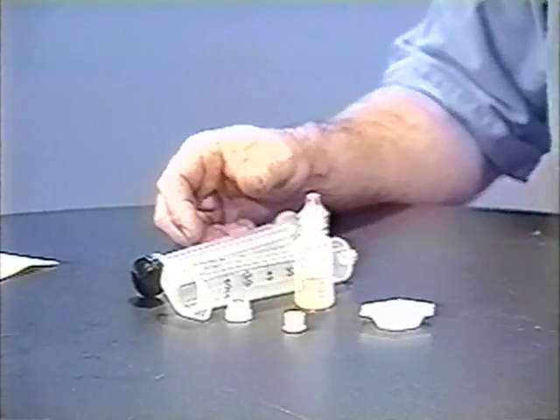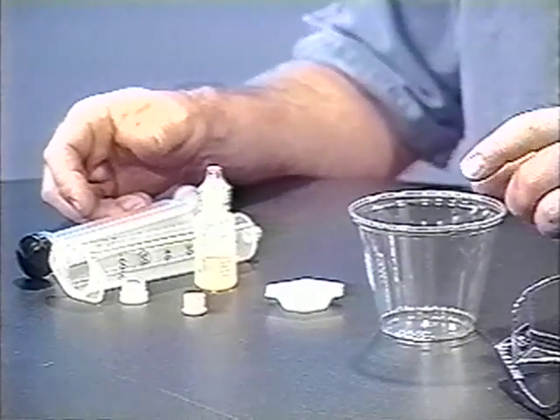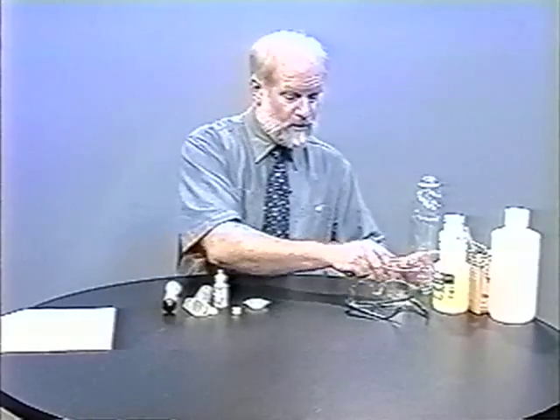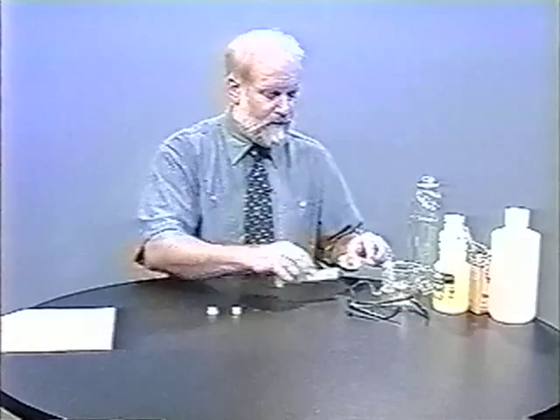We'll need a little dish for measuring out our liquid reagent. We'll need a cup to dispose of our reagents when we're done with the reaction. And then we need something like a one-liter soda bottle in order to allow the syringe to drain. With those simple pieces of equipment, we can generate quite a wide variety of gases.